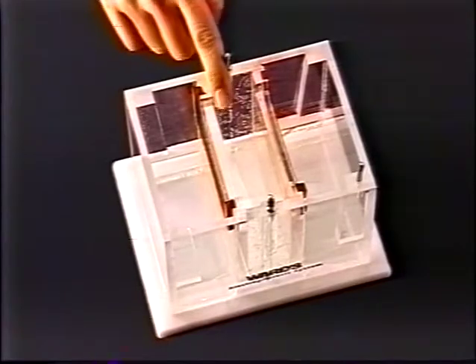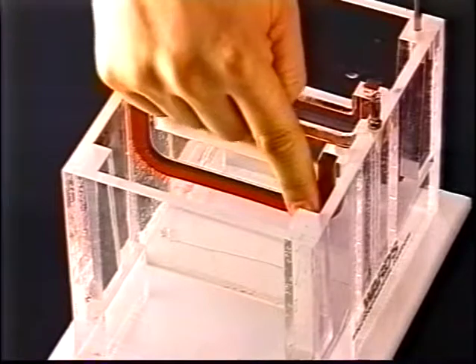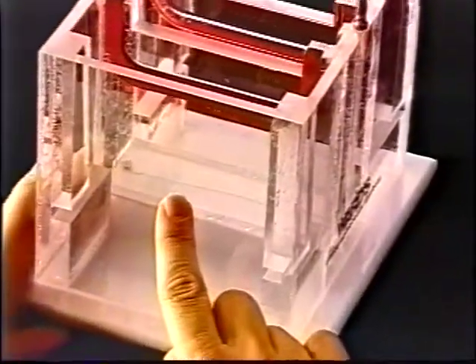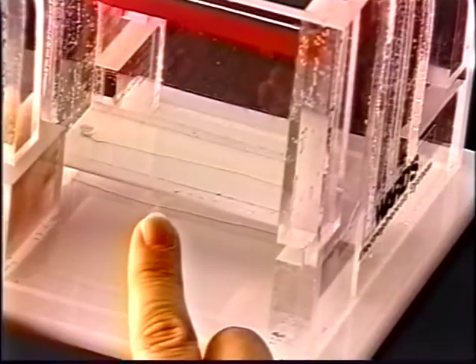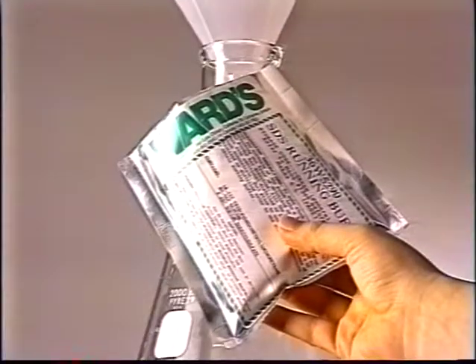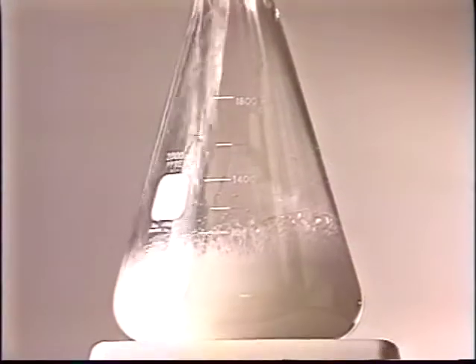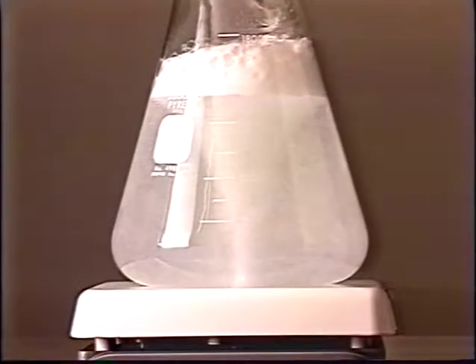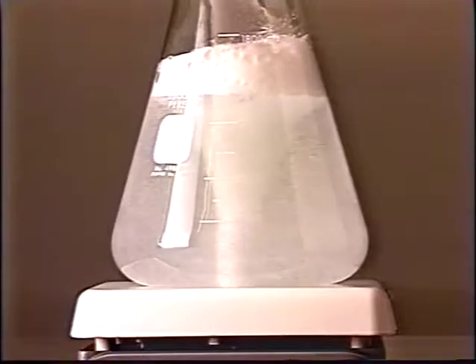The gel chamber has an inner and an outer compartment with gaskets which prevent the buffer from leaking into the outer compartment. There are 2 platinum electrodes, the cathode, located at the bottom of the inner compartment, and the anode in the bottom of the outer compartment. Prepare the concentrated running buffer solution. A working solution is then prepared by diluting 1 part concentrate to 3 parts distilled water.